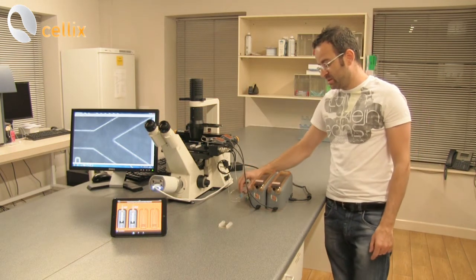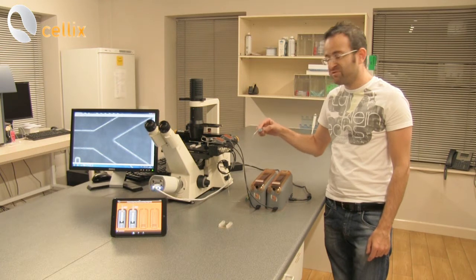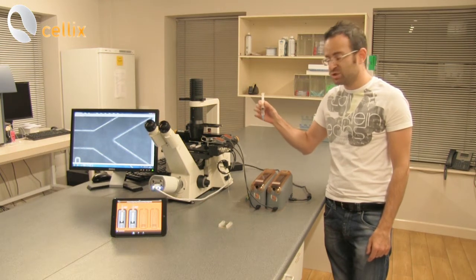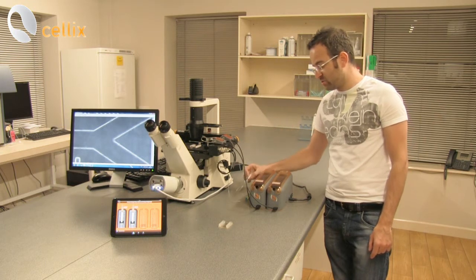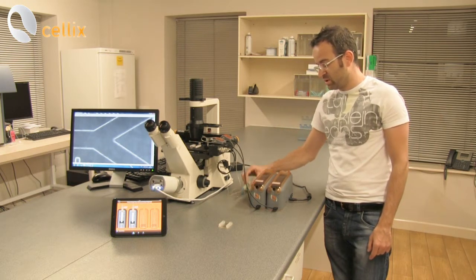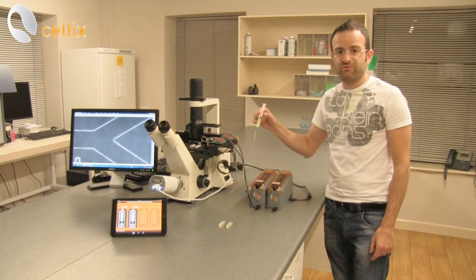For the experiment itself we are going to use a buffer solution. So we have one syringe with deionized water at the moment and we have also another syringe which contains a dispersion of particles.